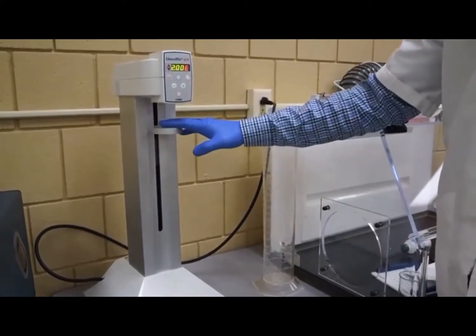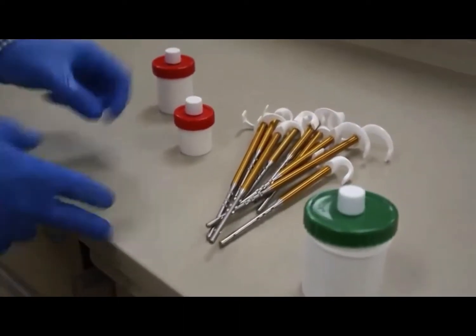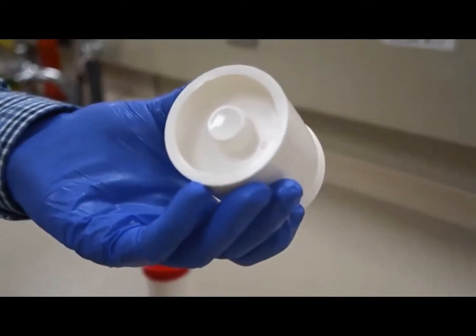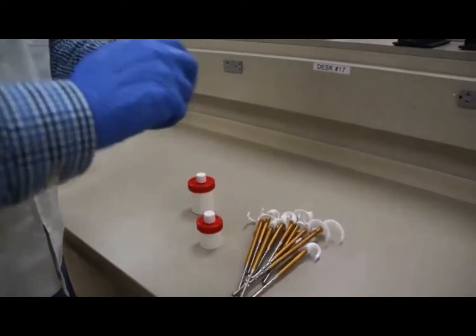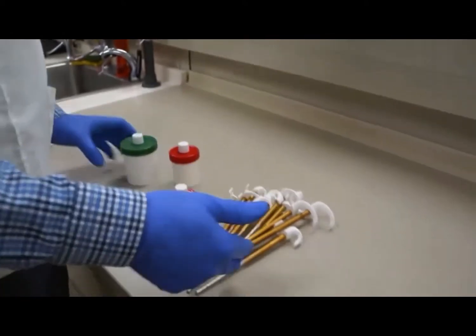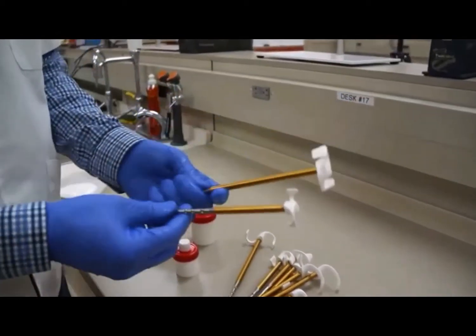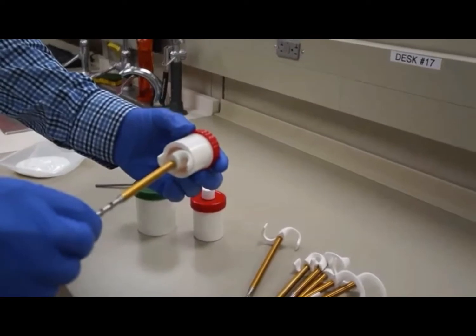The Unguator uses specially made ointment jars that come in different sizes. Each jar has a movable base that can be pushed up and down, and the cap has a hole so thick ointments or pastes can be squeezed out and recapped. The bits that the Unguator uses come in different sizes and lengths depending on the jar. They spin around and mix everything thoroughly. In this demonstration, the preparation includes 4 grams of cetyl alcohol and 76 grams of white petrolatum, which have been placed into the jar, with water to be added later for a total of approximately 100 mL.